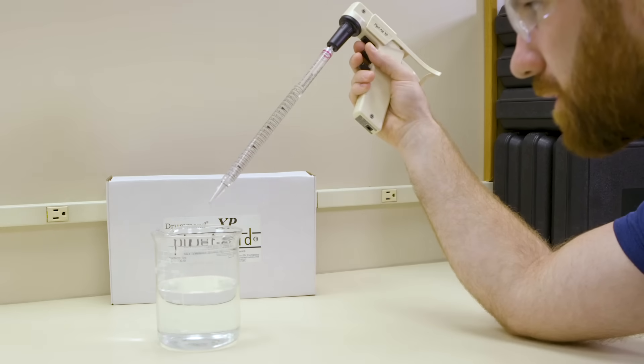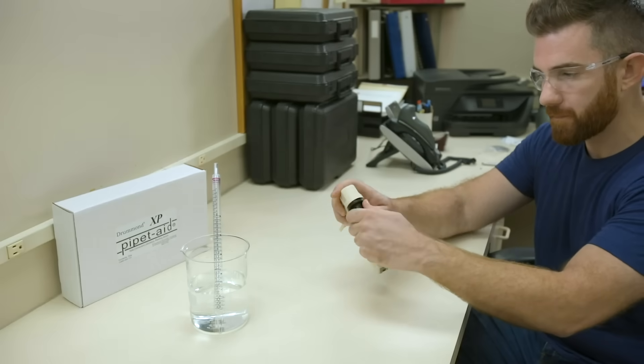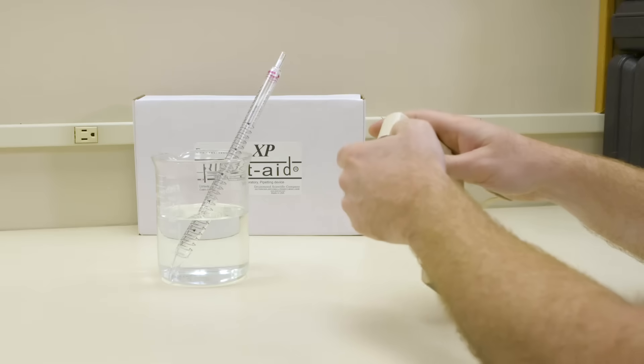Pipette aid will not hold volume when pipette is filled. Probable cause: Make sure all components are in the nose piece and fit properly.